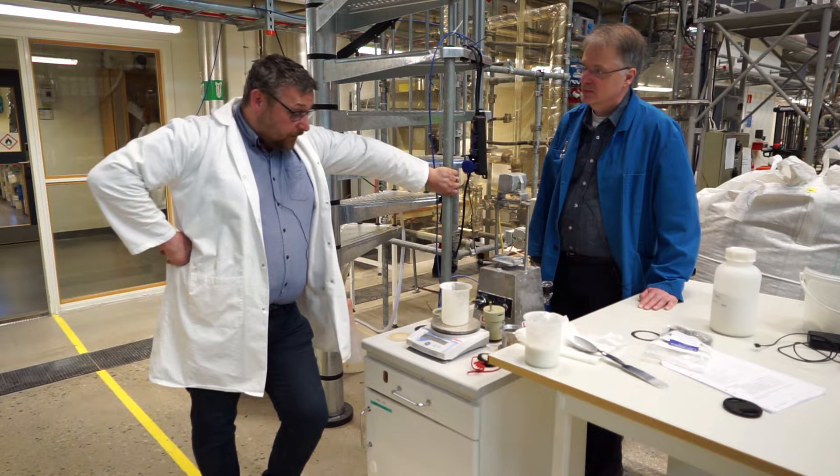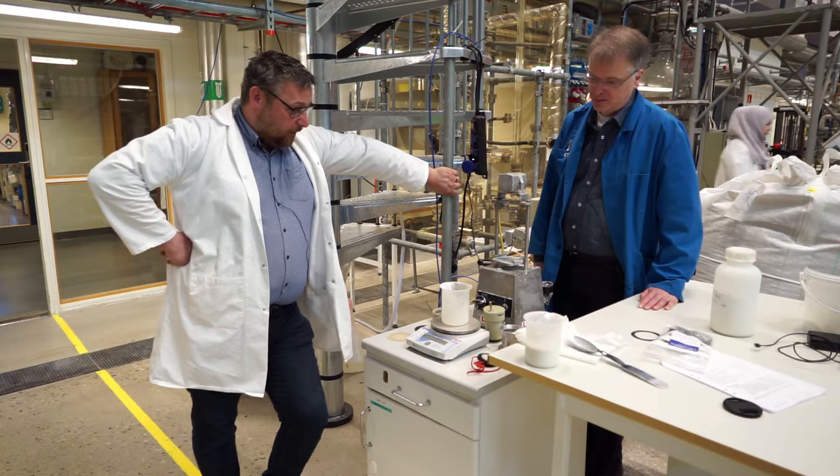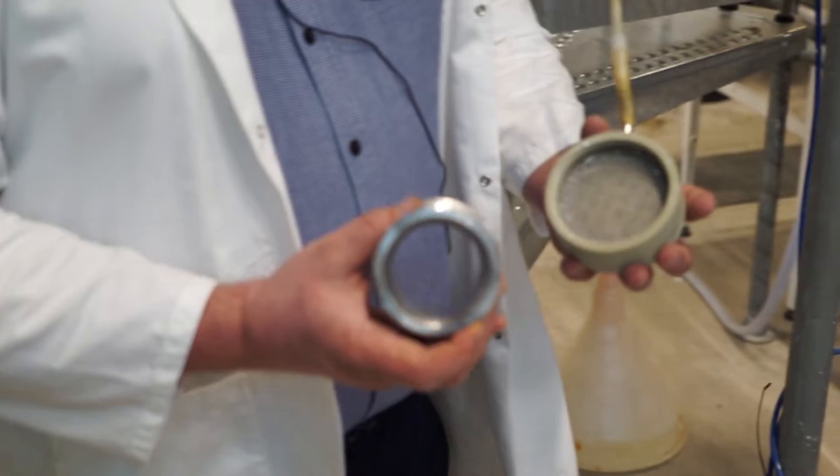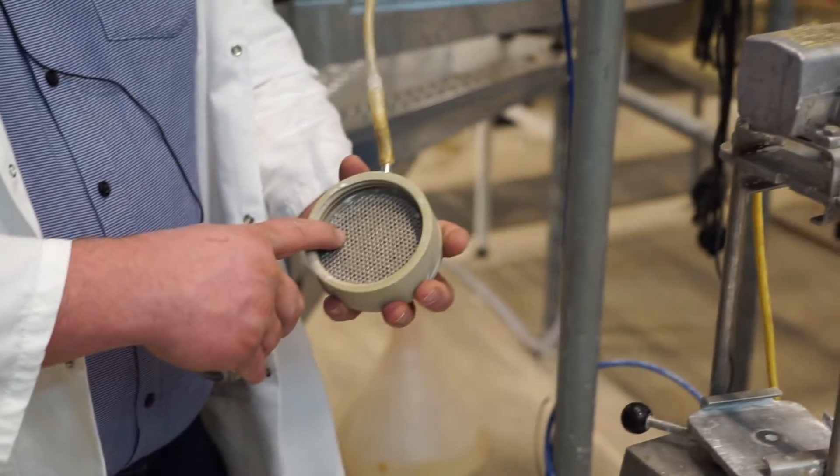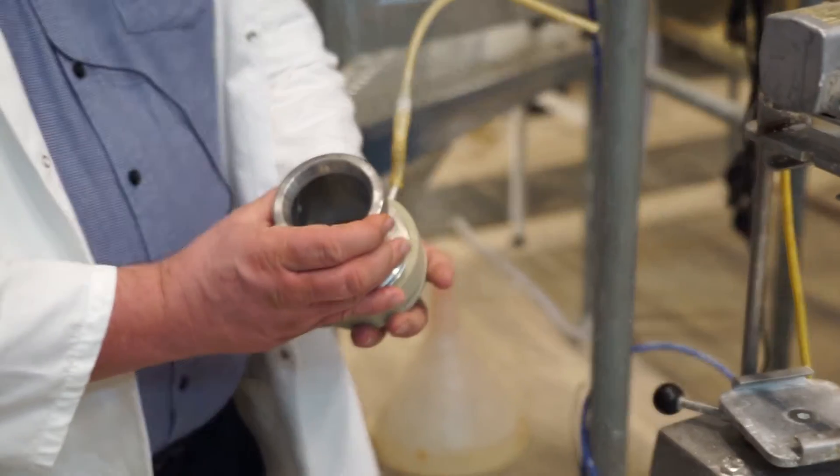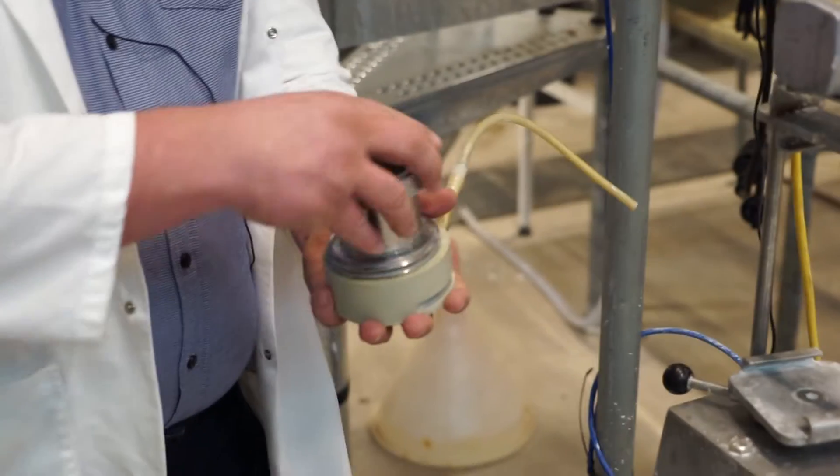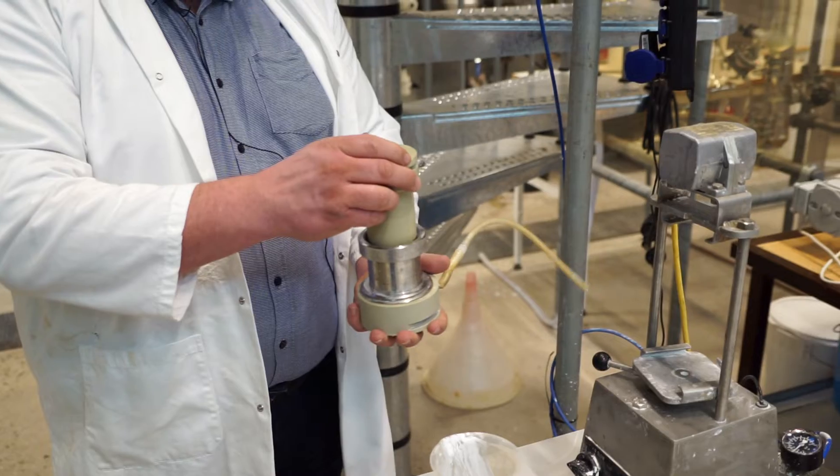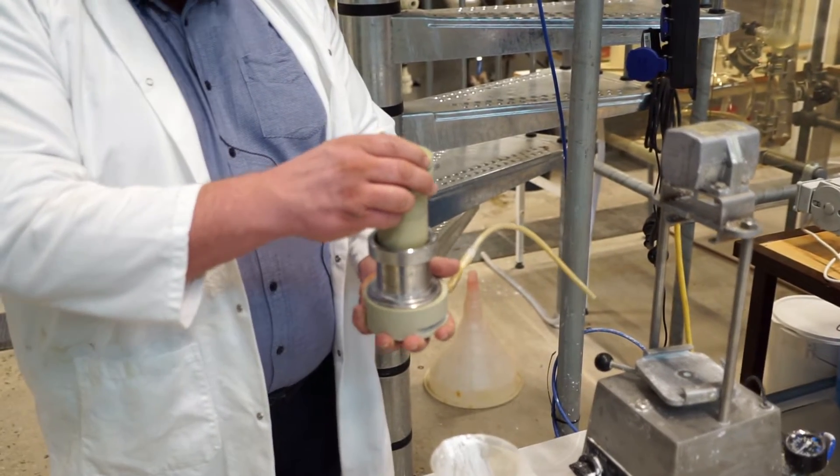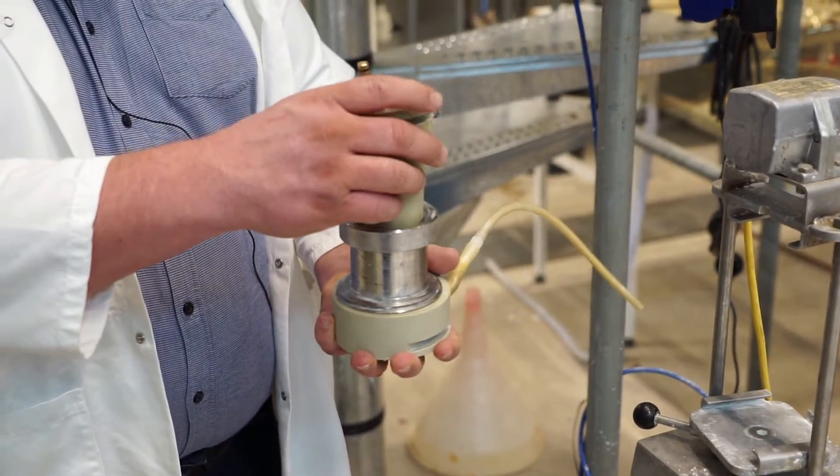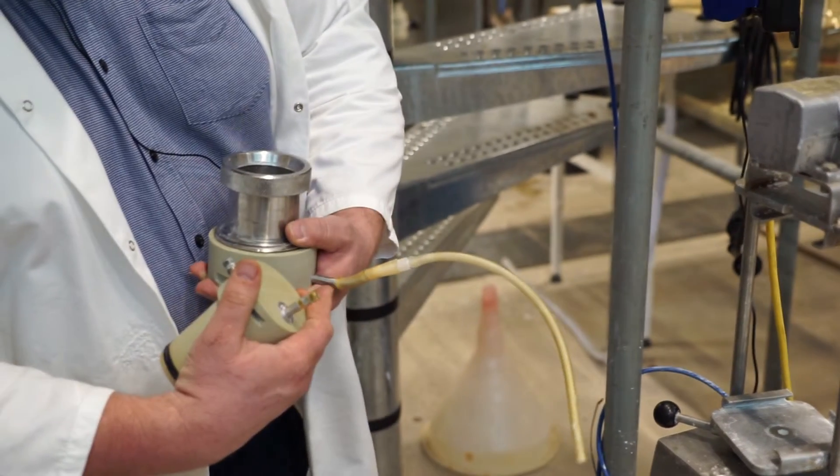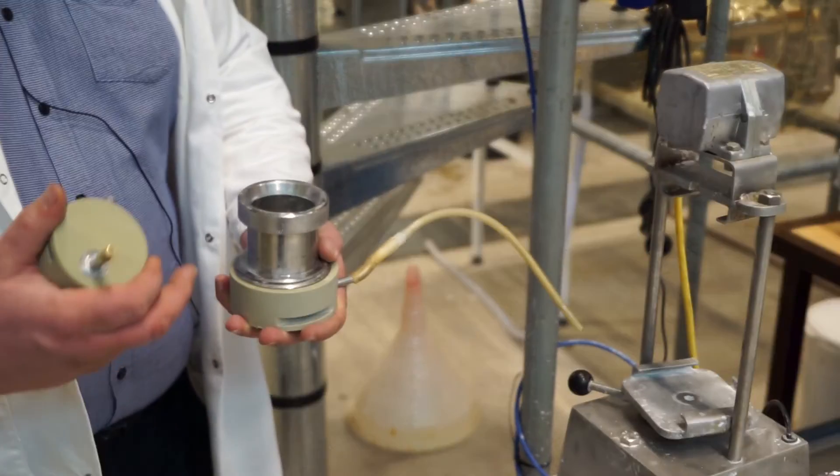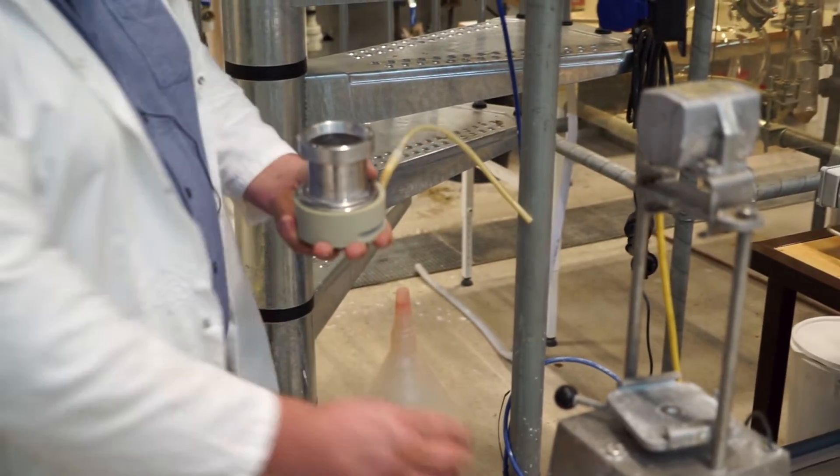So it's a fairly simple piece of equipment. It's a filtration chamber with a support for the filter cloth that you put on top here. And on top of this we have a piston that is pushed down into the solution and displaces the solution out through the filter and into a collecting vessel. So that's basically it.